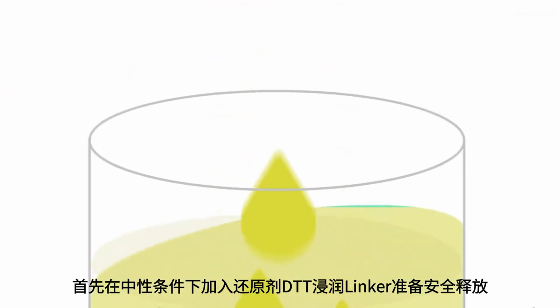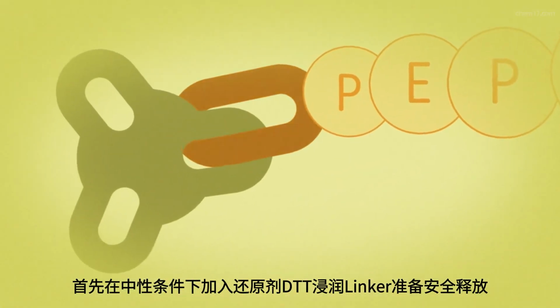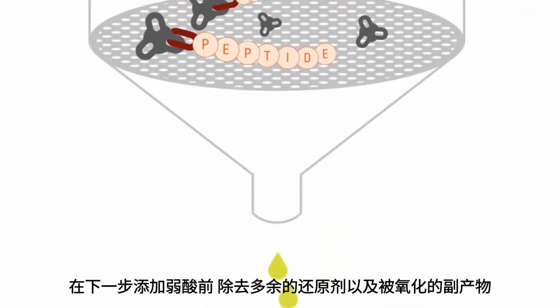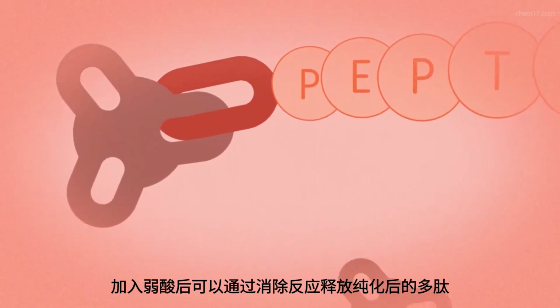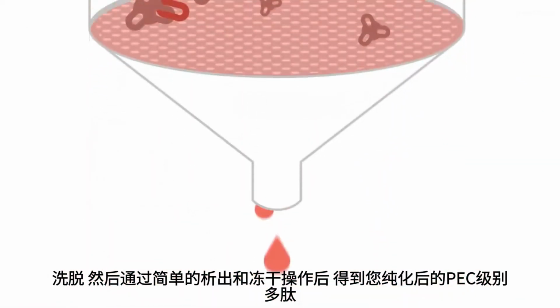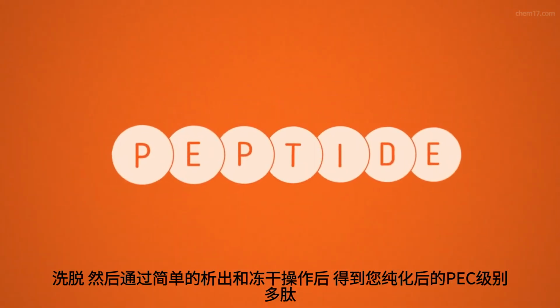First, add DTT as a reducing agent at neutral conditions to prime the linker for release. Remove reducing agent overload and oxidized byproducts before the subsequent addition of weak acids, which will release your purified peptide in an elimination reaction. Elute and obtain your purified PEC-grade peptide for a simple workup by precipitation or lyophilization.